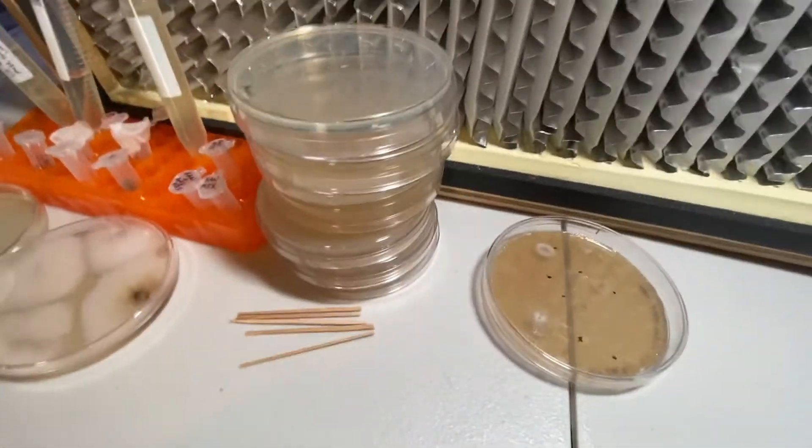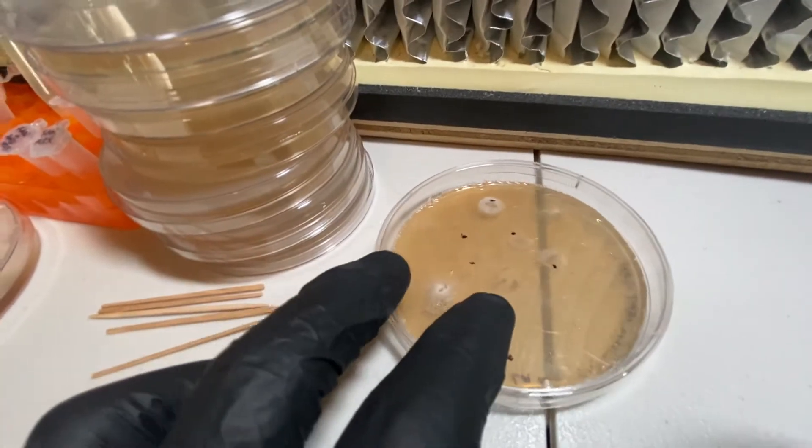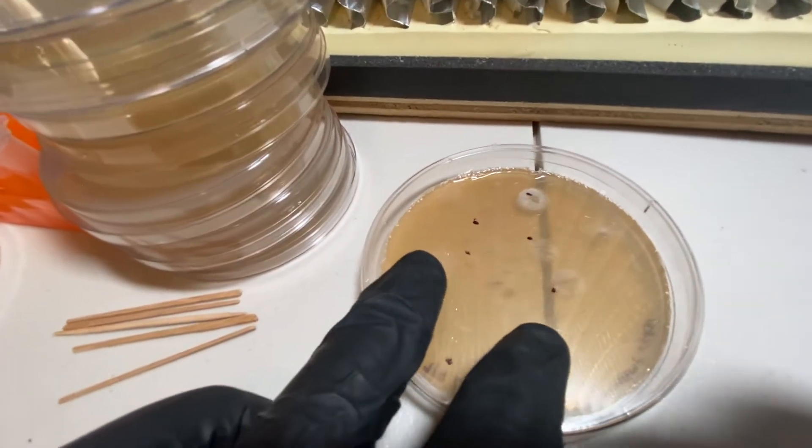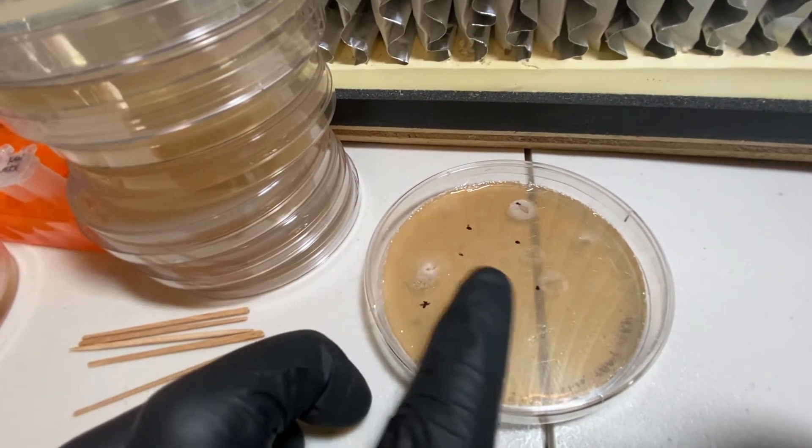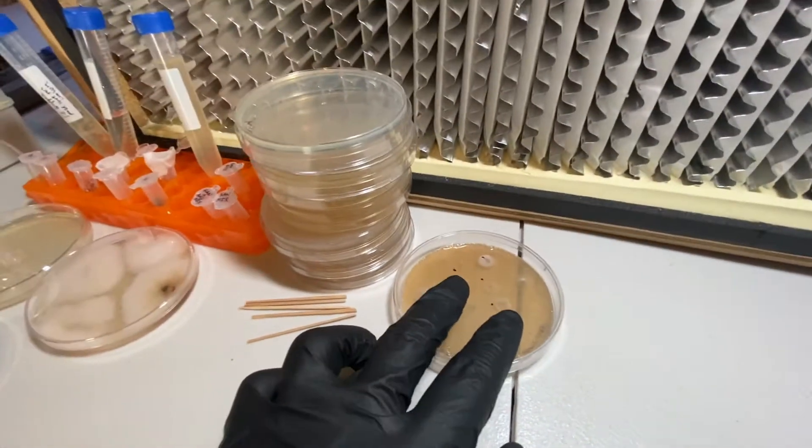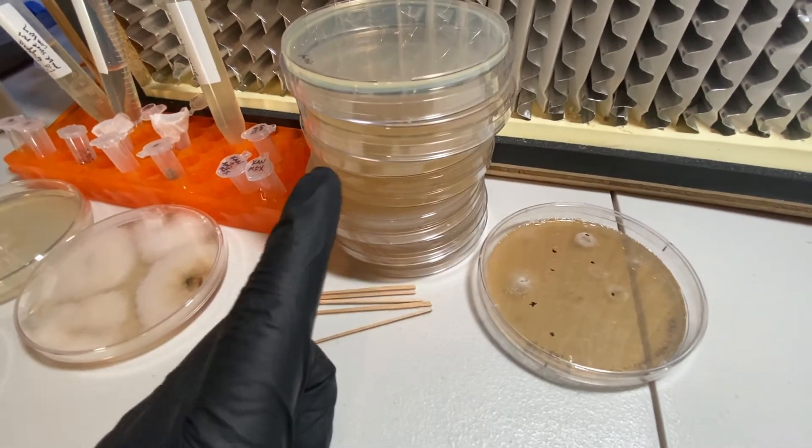If you saw what I did, I had to change. Things always change in real time as you're doing them. As I began to go through here and take a better look at them, I found a lot of similarities between these. The more that I looked at them, on some of them it took me a little bit of time to decide which ones I wanted to pick to put over here.